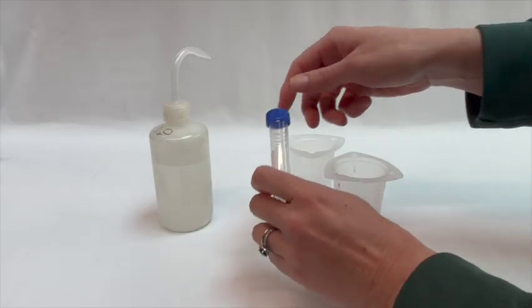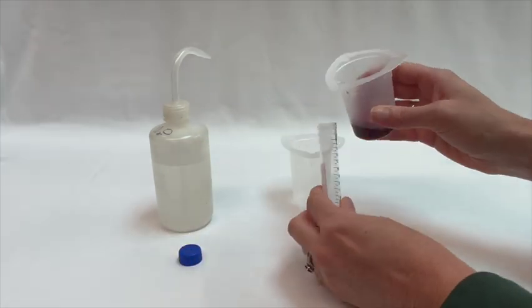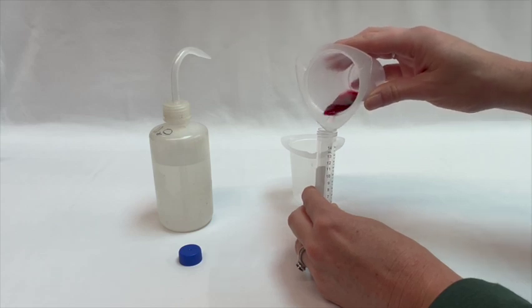Once at room temperature, pour the sample into the provided conical tube and add DI water to restore the volume to 10 ml. Here, we will use our rinse bottle to do this.